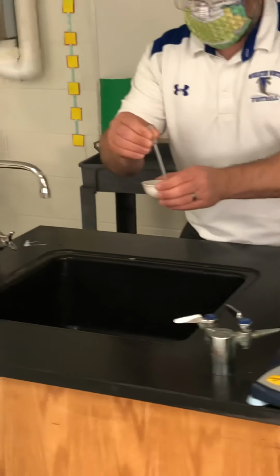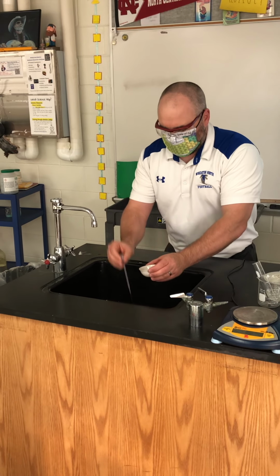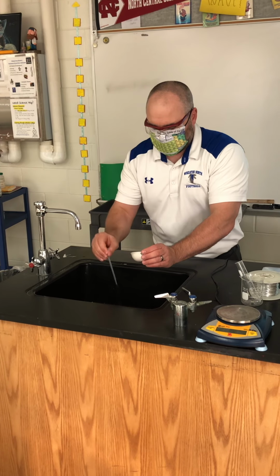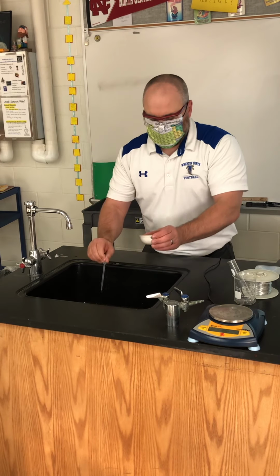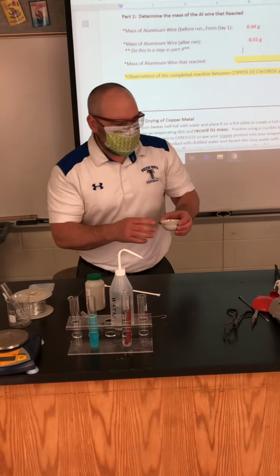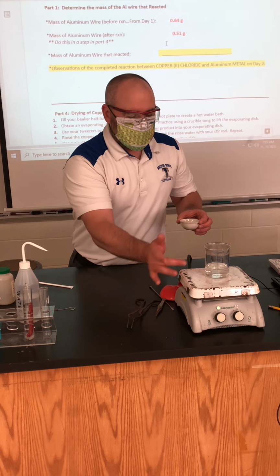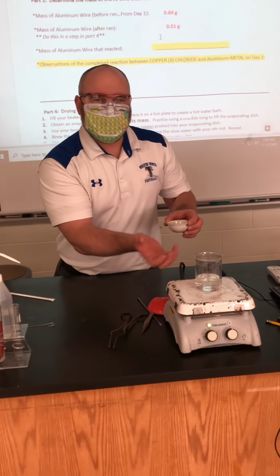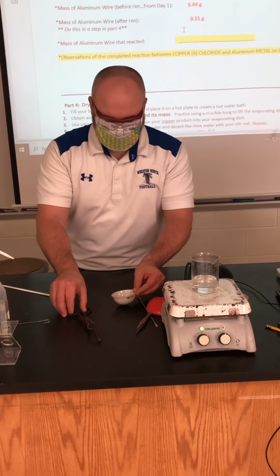And what I'm going to do is just simply suction off the rest of that additional water. Now we have some fairly wet copper particles. And what I'm going to do with them is I'm going to place them onto this drying apparatus. What I have here is a beaker with boiling or nearly boiling water that's going to serve as like a hot water bath, a steam bath, if you will, to heat this. I'm going to place this on top using crucible tongs.